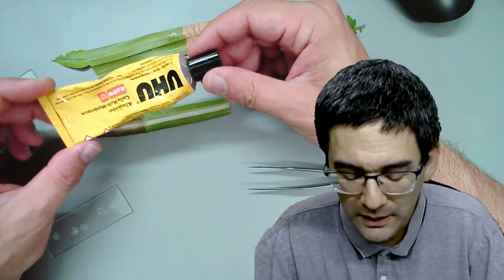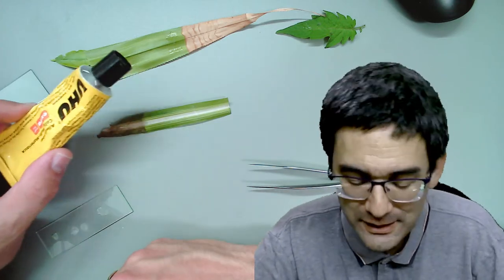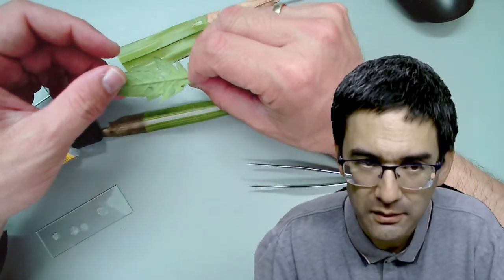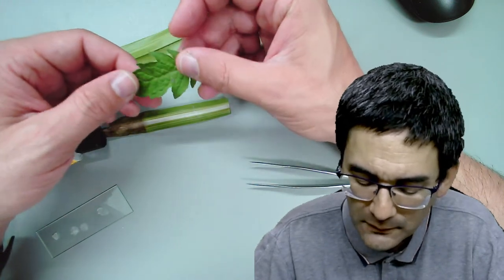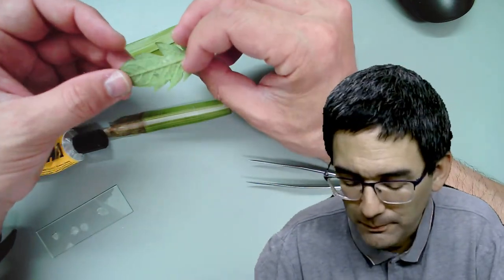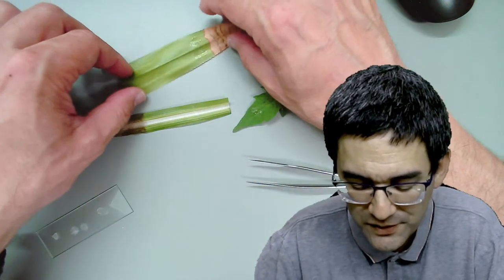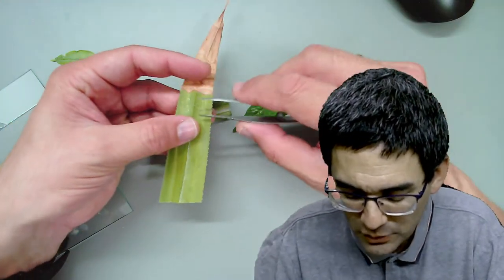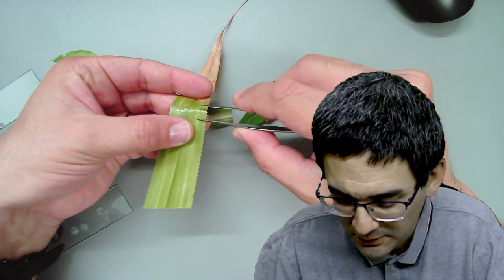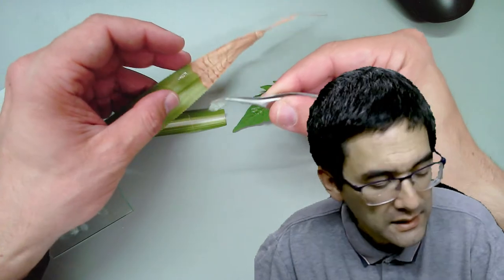The main factor for success or failure is indeed the surface texture of the leaf. The tomato leaf is the most difficult one - some leaves I've tried I was not able to get the glue off at all, especially if they're fuzzy and have lots of hair. Some of the glue really separates quite nicely and easily. It's also possible to experiment by applying a second layer.